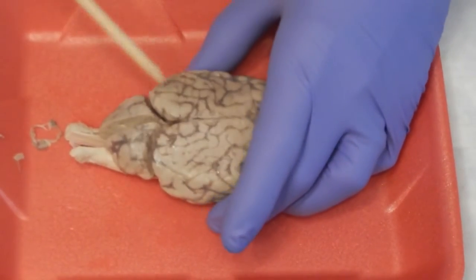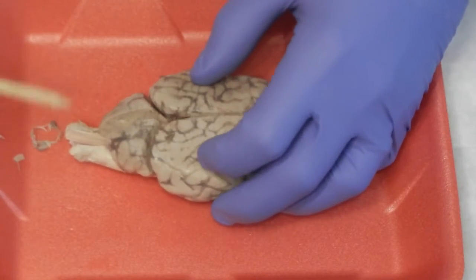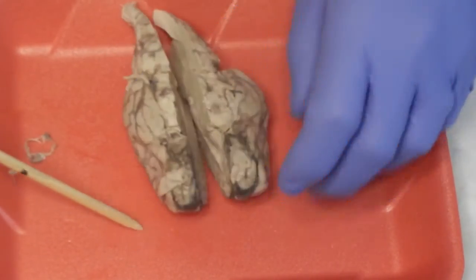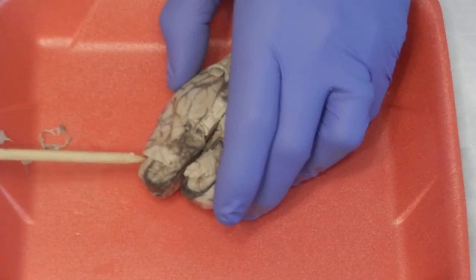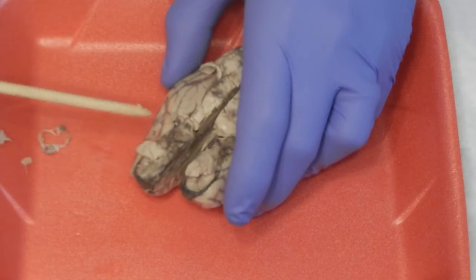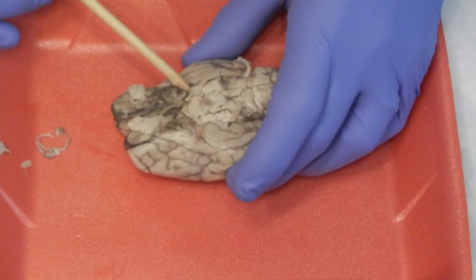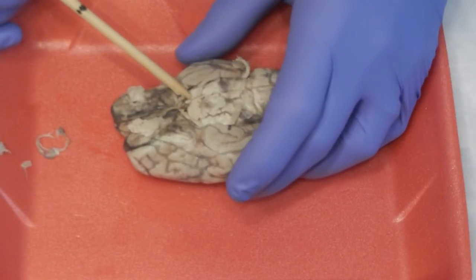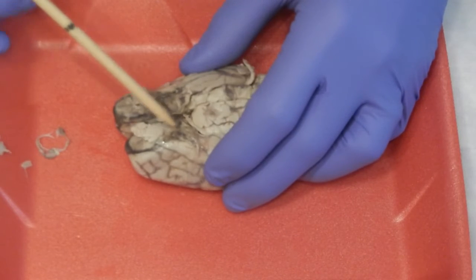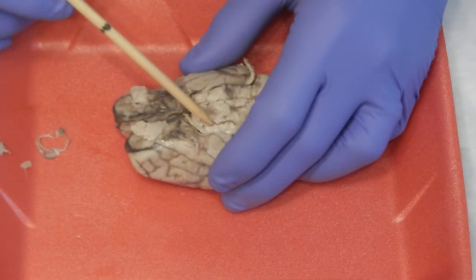So once we go through and we see, of course, the cerebrum, cerebellum, frontal, parietal, occipital lobe, and the temporal lobe, we turn the brain underneath and we'll see these two little protrusions right here. These are the olfactory bulbs, responsible for smell, which go down the olfactory tract. And we can barely see it, but this little area right here, which I cross-sectioned on a different area, there are two little points that jut out here. This is where the optic nerves would come in. Okay, they would come into the optic chiasm, which is where they cross.